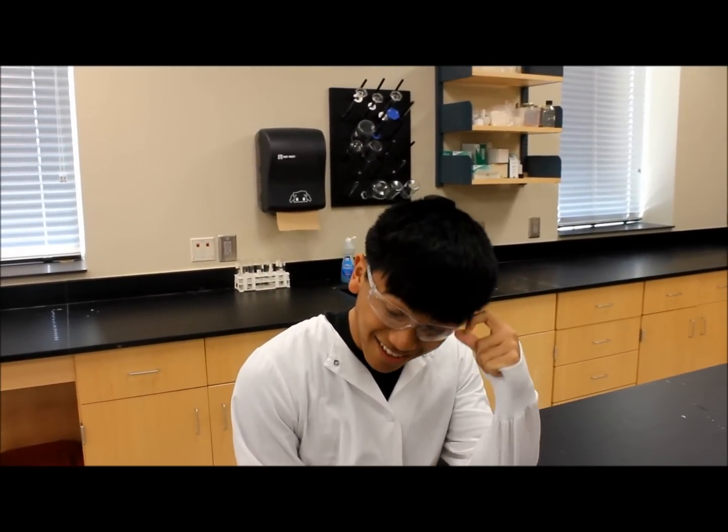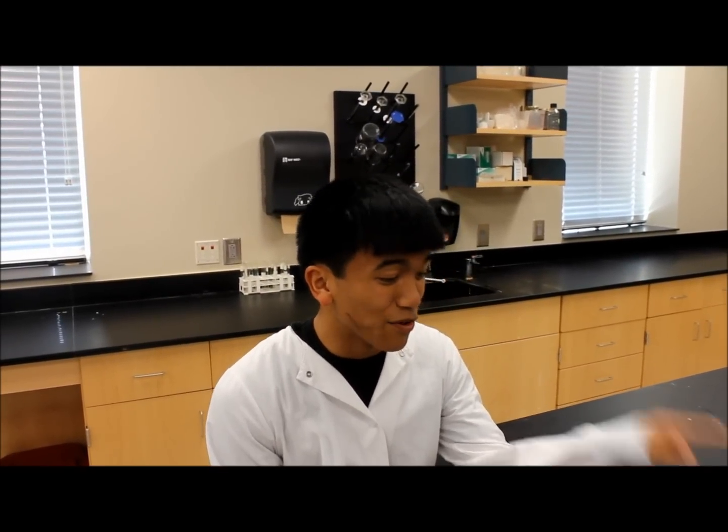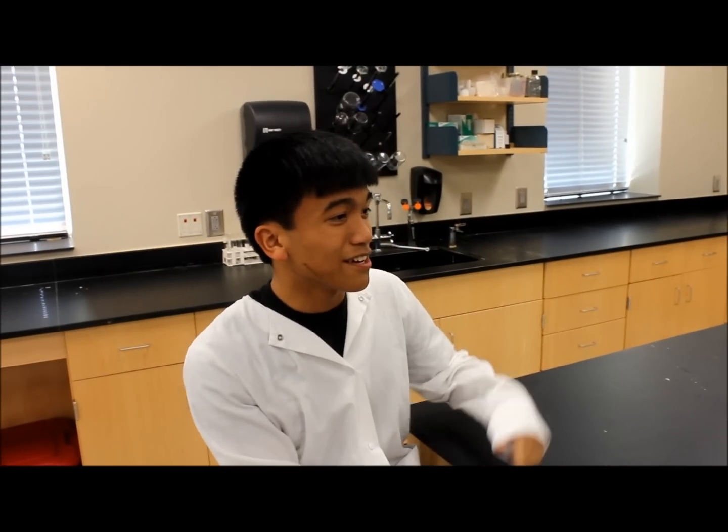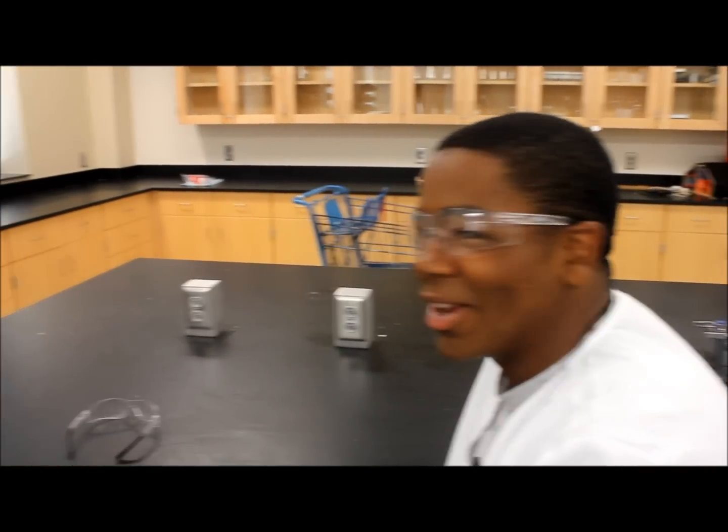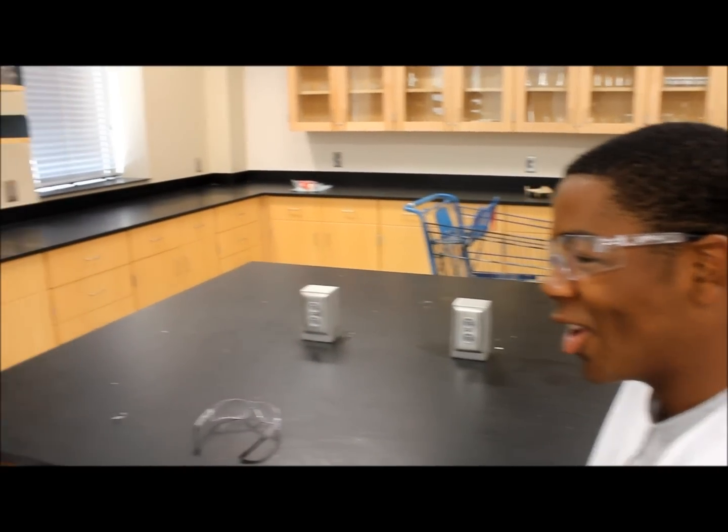Okay, so let's say, name your top 10 lab safety rules. Top 10, jeez. Okay, goggles, no horsing around, make sure when you have your chemicals, make sure they're not at the edge of the table, make sure to turn off your gas. Any more, TJ, my crazy lab partner? No eating in the lab. Yeah, no eating. I get in trouble for that a lot. Any others?